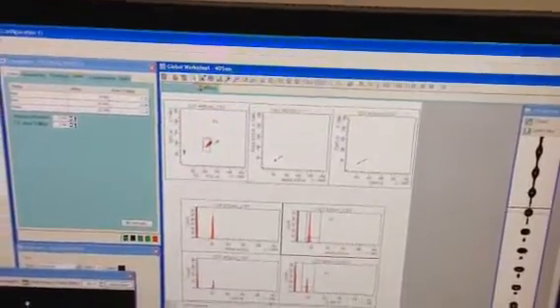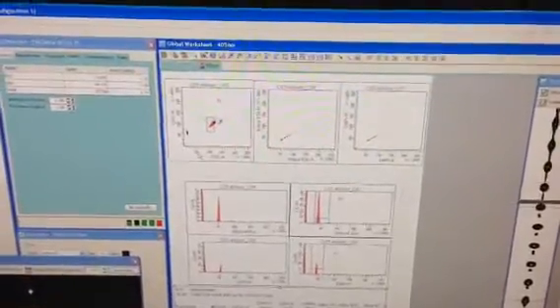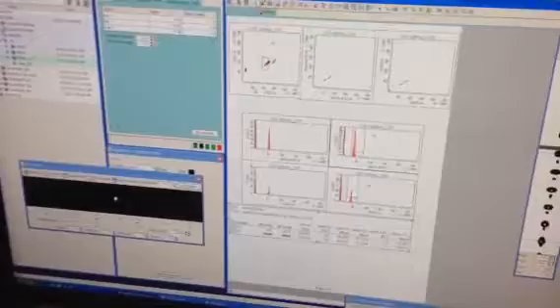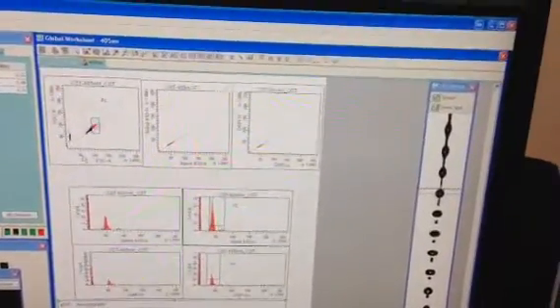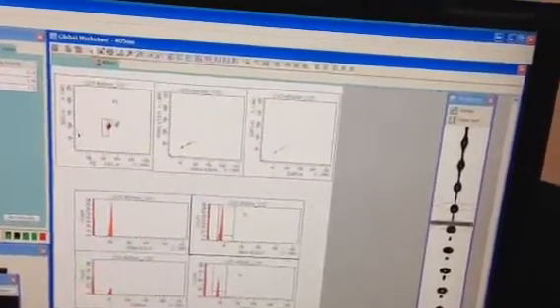So there's a sweet spot. And we're always adjusting for optimum. And if I adjust the other sweep, you see that it's pulling the signal out of the window altogether on both channels. So I have adjusted so that I get a nice, tight, coherent population for the beads.